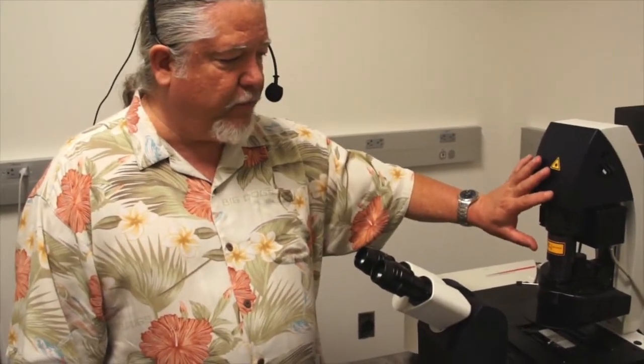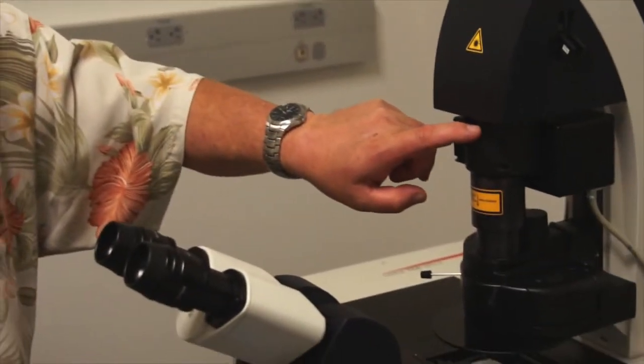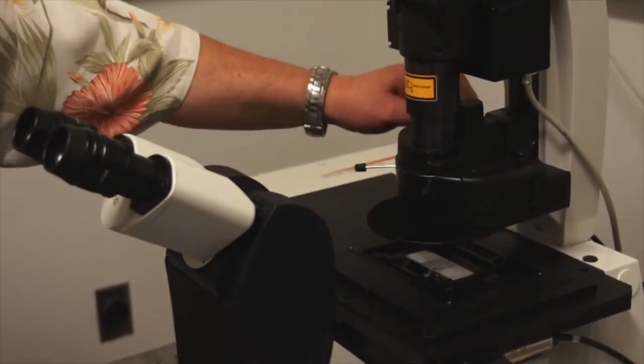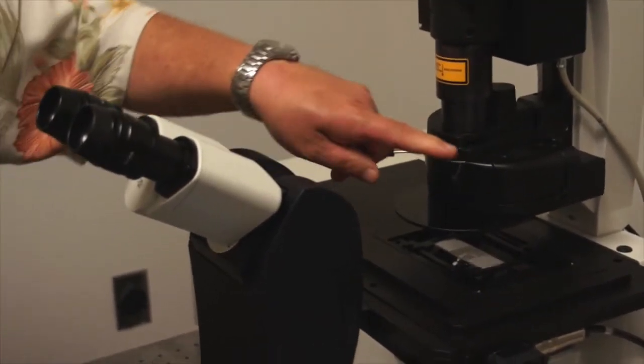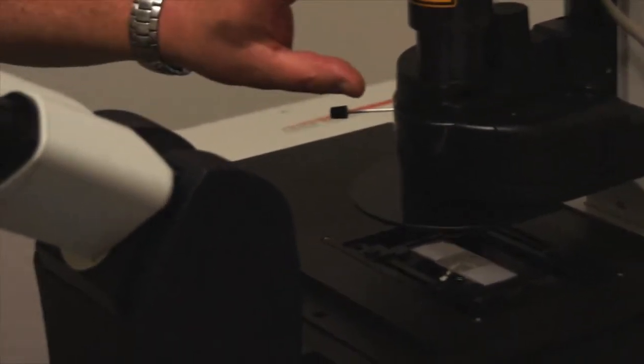As mentioned previously, Köhler illumination, or alignment of the light path to the optical path in the microscope, is very important. You must do it for each objective that you're working with. To do this, we're going to use features of the illuminator. We're going to manipulate the field diaphragm, and we're going to manipulate the height of the condenser by turning the knob up and down. And we're going to use these two alignment tools to align the condenser to the optical path.